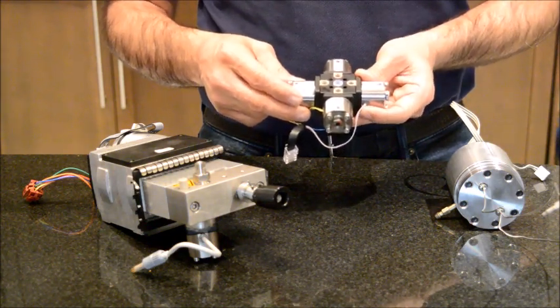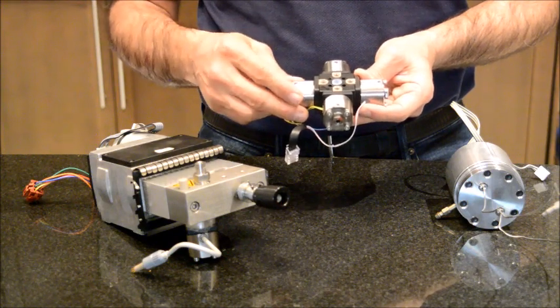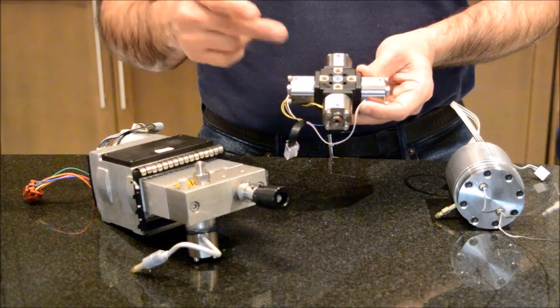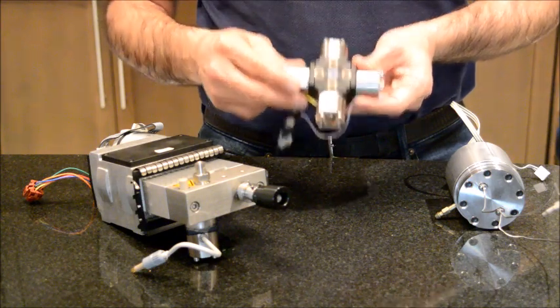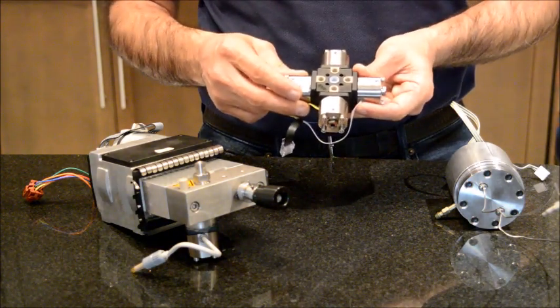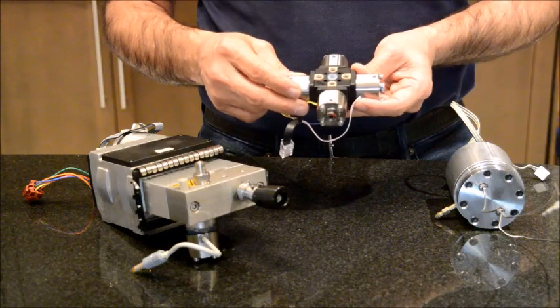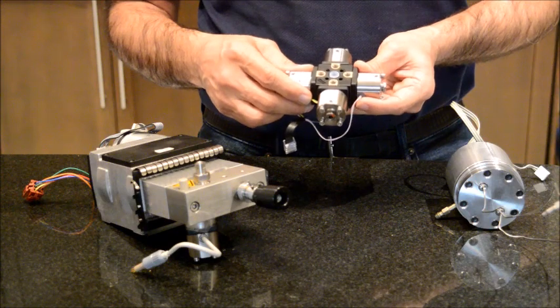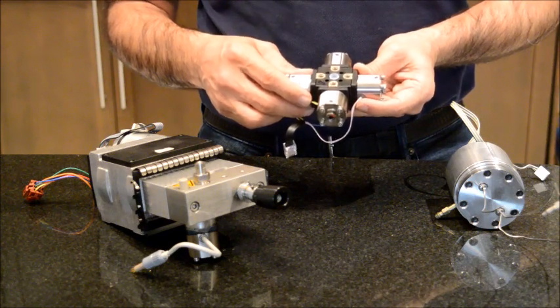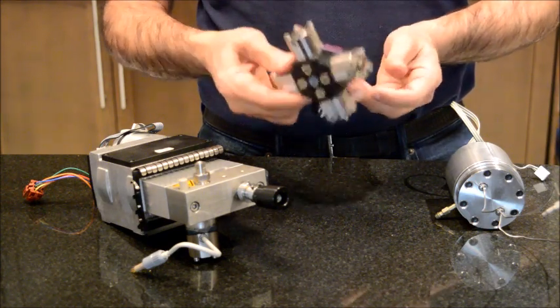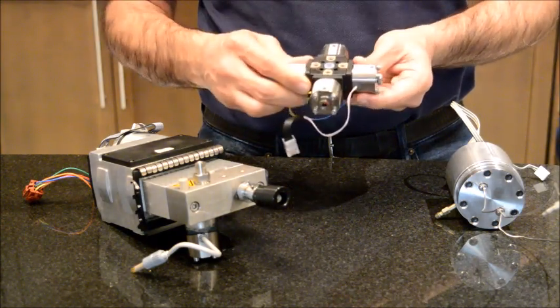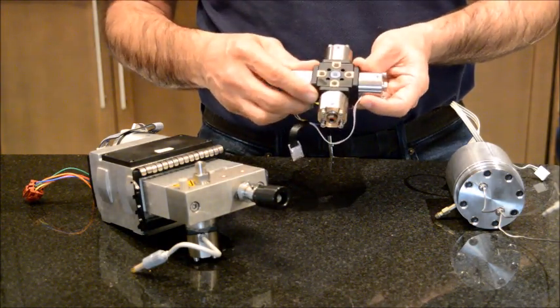It is possible that your problem comes back again. In this case, maybe you need to consider doing something more than washing on the gradient proportion valve. Option number one, which is the easiest choice but the most expensive option, is to replace the proportion valve. Buy a brand new one and install it. That's very easy but very costly.